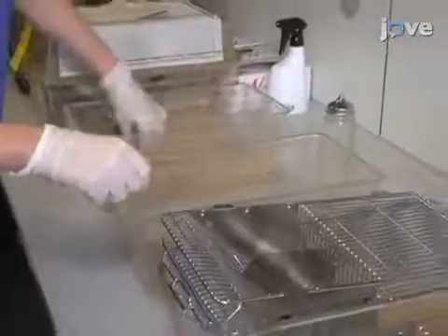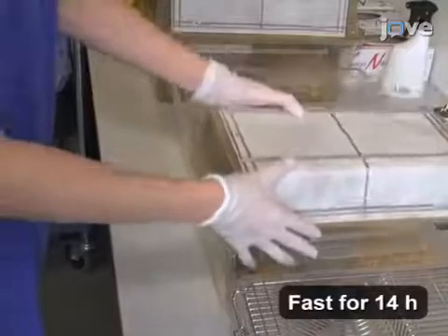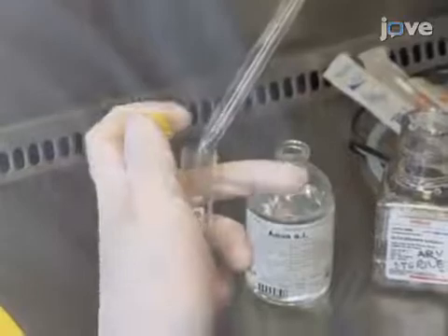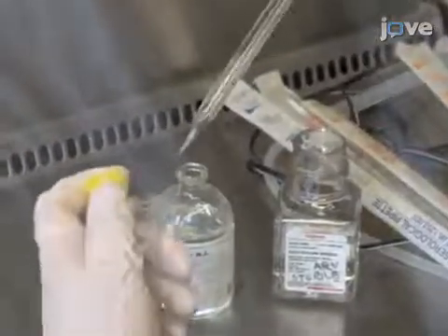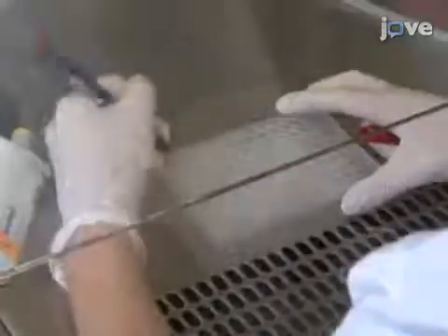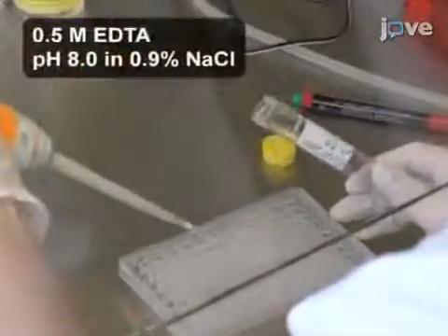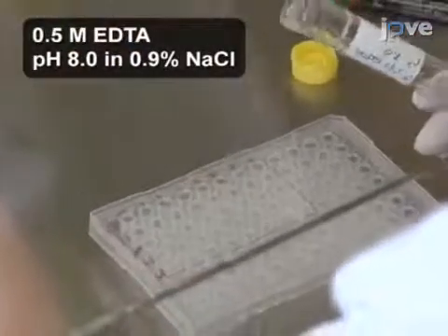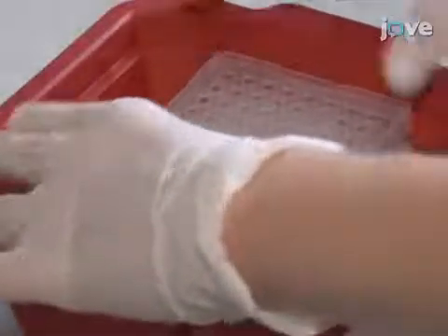The day before the oral glucose tolerance test, transfer mice into a cage with fresh bedding and drinking water, but without food to fast them overnight before testing. The next day, prepare 10 mL of 20% glucose solution by diluting 45% D-glucose in distilled water. Then prepare a plate for plasma collection by adding 5 µL of sodium EDTA per time point for each mouse to the wells of a 96-well plate. During the experiment, store this plate on ice.